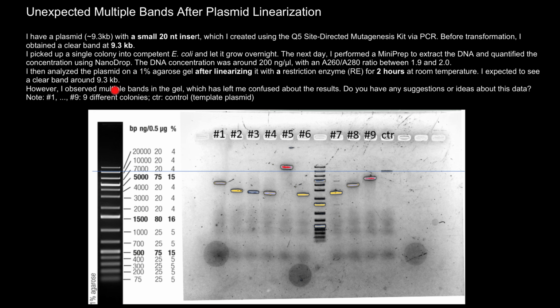However, I observed multiple bands in the gel, which has left me confused about the results. Do you have any suggestions or ideas about this data? And here are the bands that this researcher got. Instead of getting bands around 9.3 kilobases, which band has to be somewhere here.